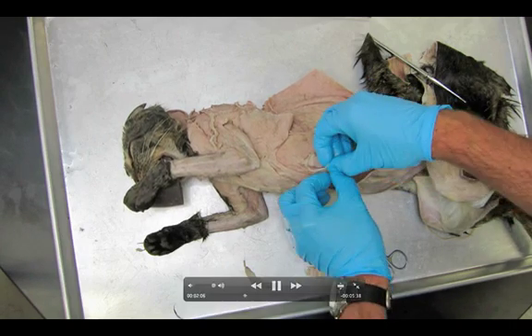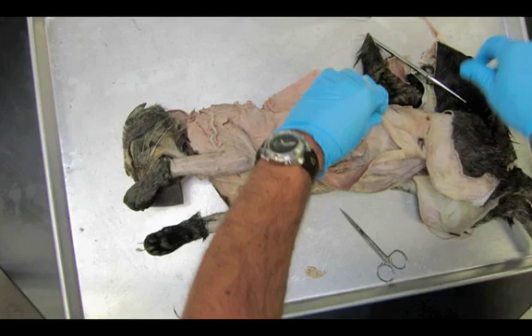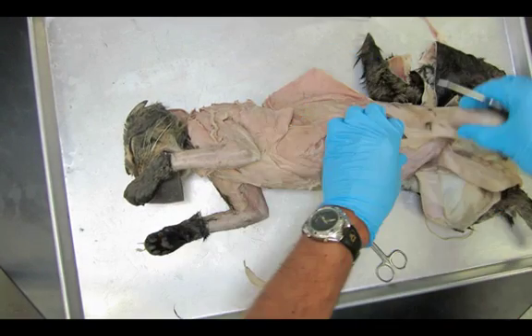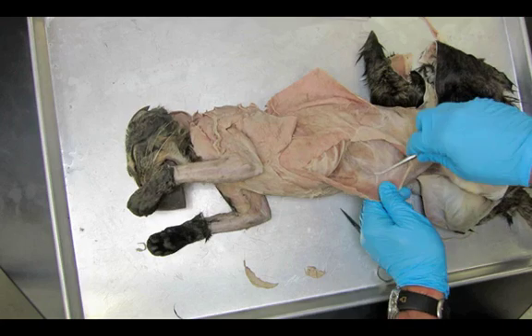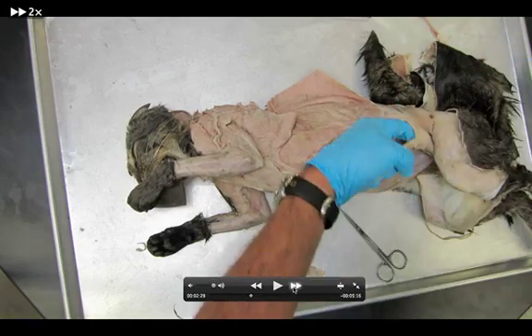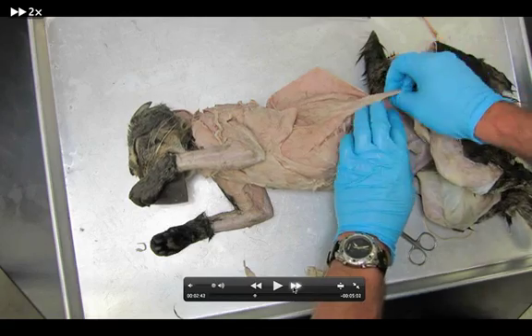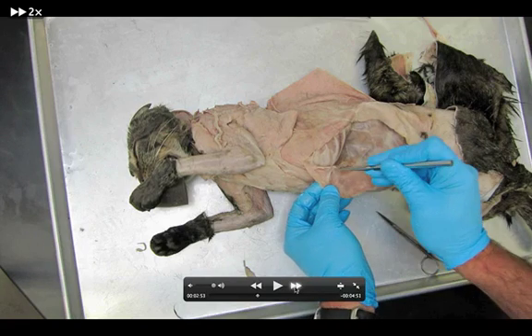It's actually going to be kind of connected to it. Use your fingers, use your probe, and you're going to see the rectus abdominis and how it's set up here. I am using my probe, freeing up all of the connective tissue that's in between the external and internal oblique. I might need to make one more quick incision here to fully free up the inside. And there I go — last little cut right there with the scissors. I've got a great view of the internal obliques, and now I'm going to start working on the rectus abdominis.